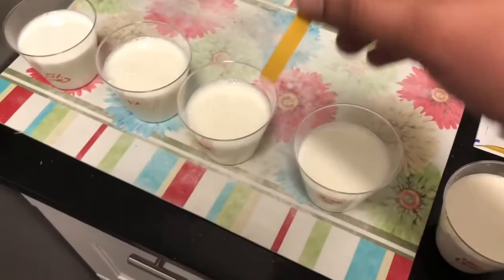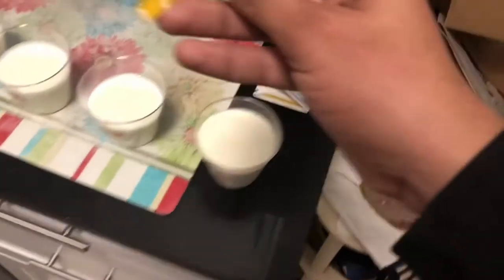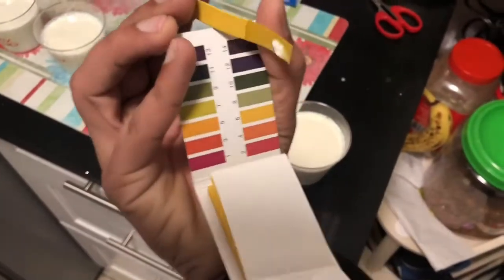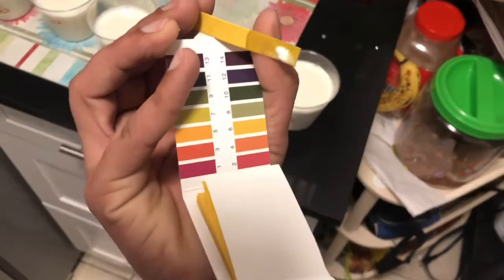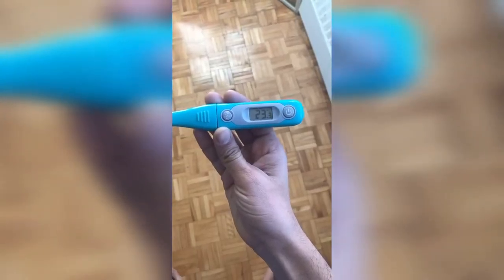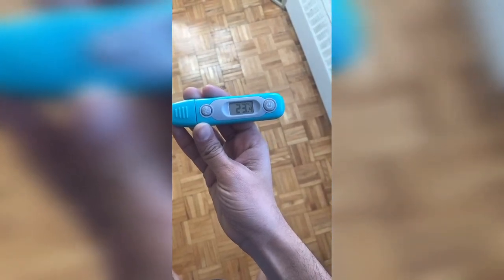First we check the initial pH of our inoculated milk. The normal pH of inoculated milk is not acidic. We can measure it with the color, which is around 5 to 6, that of milk. After formation of yogurt it will become acidic, so we will check it again. My room temperature is 23 degrees Celsius. So now we will keep our freshly inoculated yogurt at this temperature and see in what time it will be prepared.